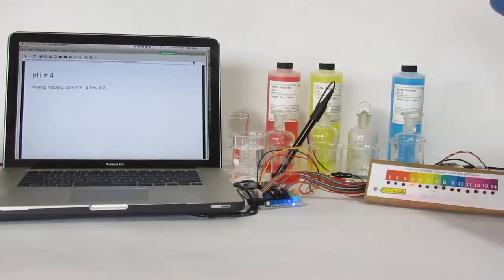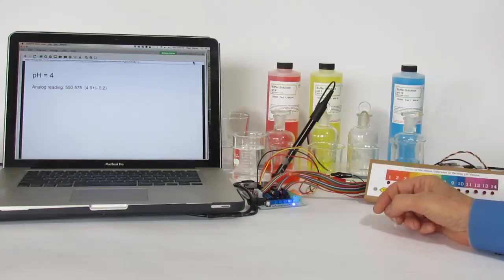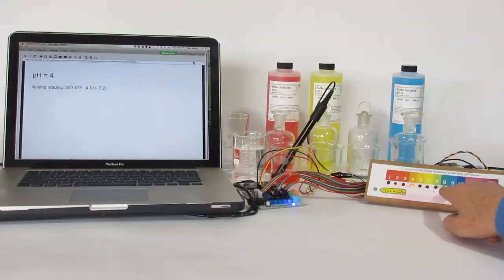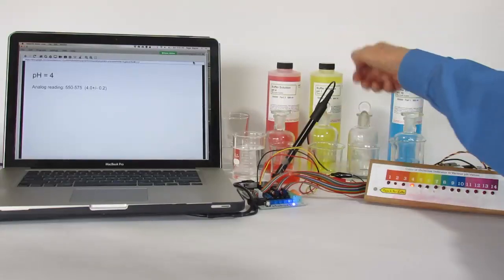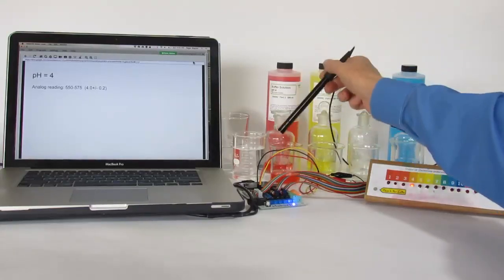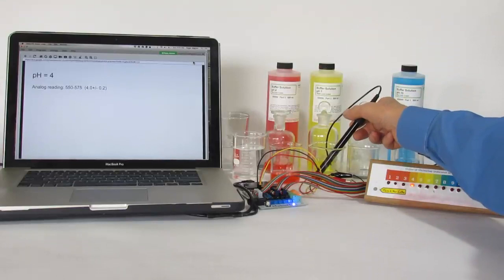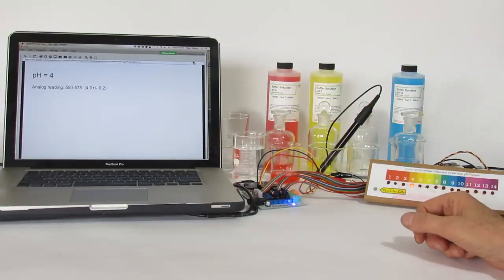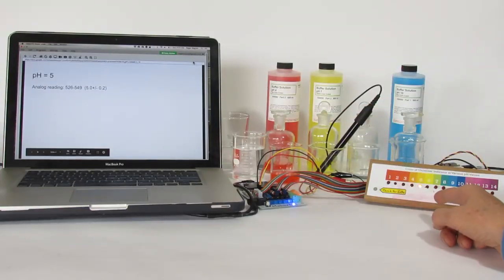Now you could imagine with the titration we'd be adding the sodium hydroxide and that pH would be moving up till it gets to 7. I have a buffer solution here, pH 7. We'll put the probe there. You see it moving up as the probe responds to the difference in pH.